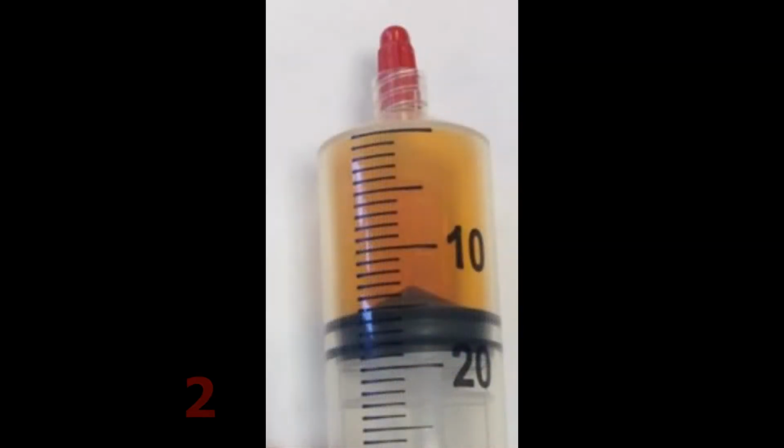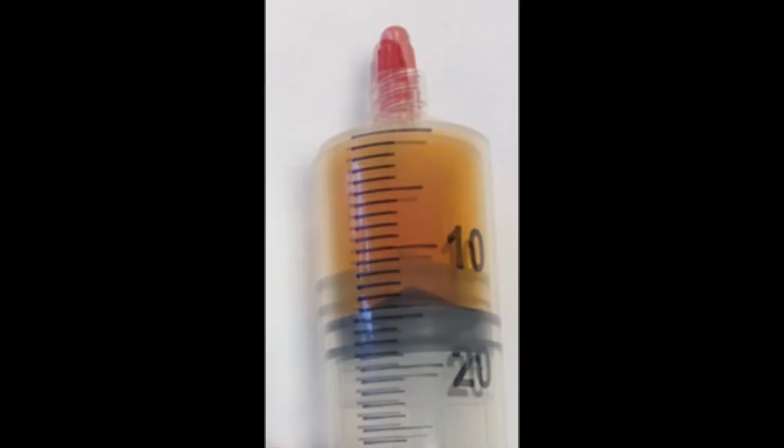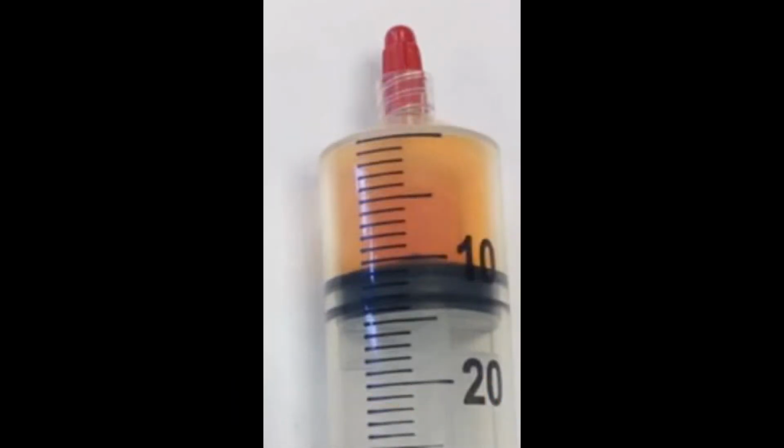Pressure can affect equilibrium as well. Here is a syringe containing a mixture at equilibrium of nitrogen dioxide and dinitrogen tetroxide. The syringe is capped to prevent the escape of the gas. When you apply pressure to the syringe, initially it goes darker as the concentration of the nitrogen dioxide is increased. But it soon fades and actually ends up lighter than before.